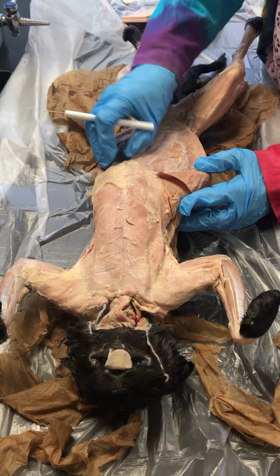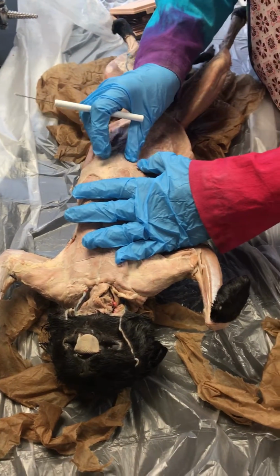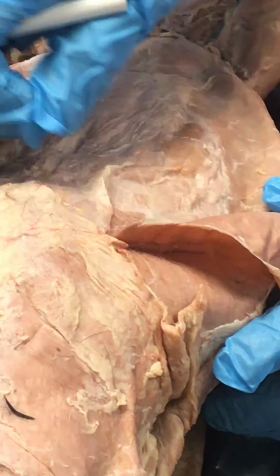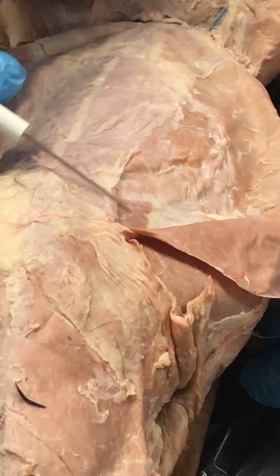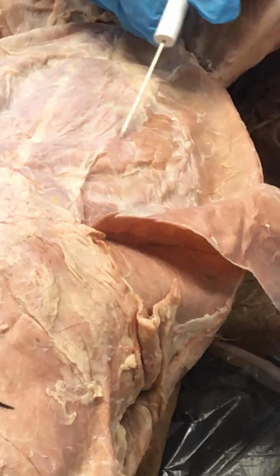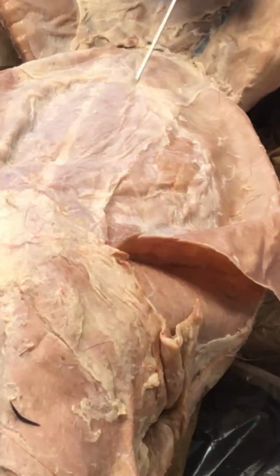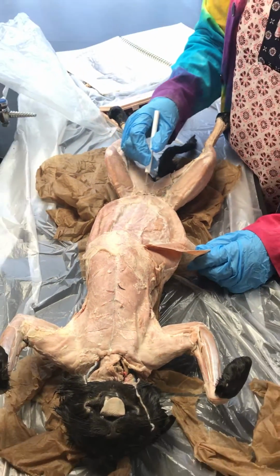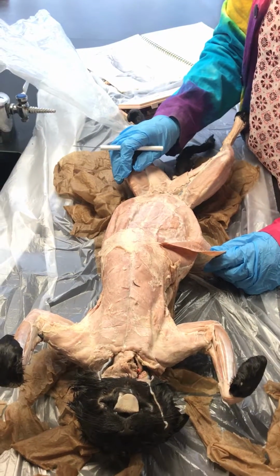And again, it's not easy, but the rectus abdominis, the fibers are running up and down, parallel. That's the dark muscle that's right in the middle that is kind of hard to see because of the aponeuroses, but they have taken the aponeuroses off here a little bit so you can see the rectus abdominis. External oblique, internal oblique, transversus abdominis, the fibers are running into the midline, rectus abdominis right in the middle of the cat, and that's the parallel fiber, the fibers are running parallel. And then that line is the linea alba that's separating both sides of your abdominal muscles.